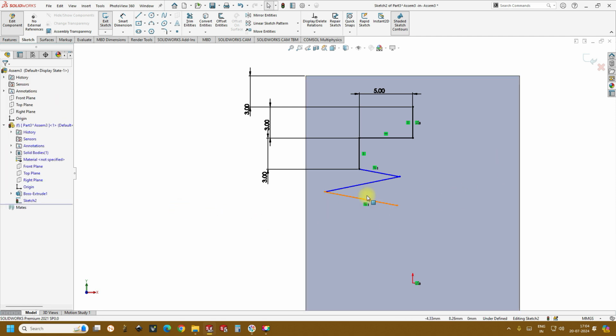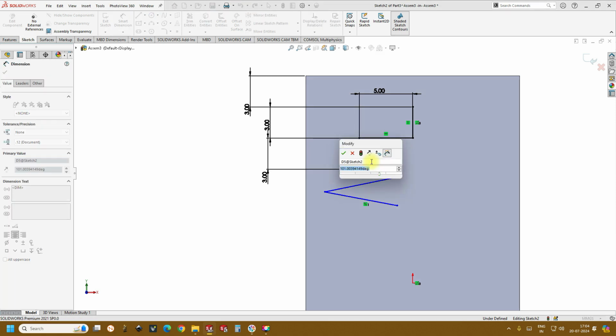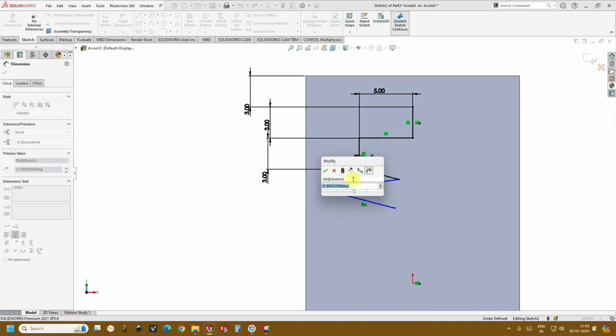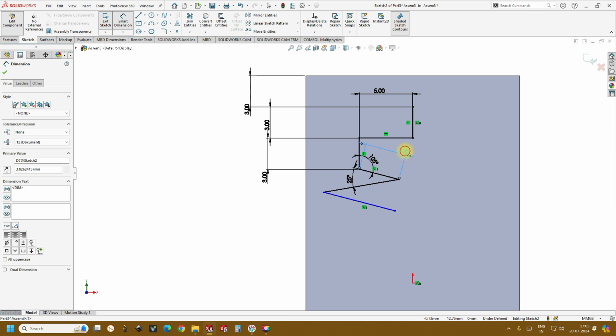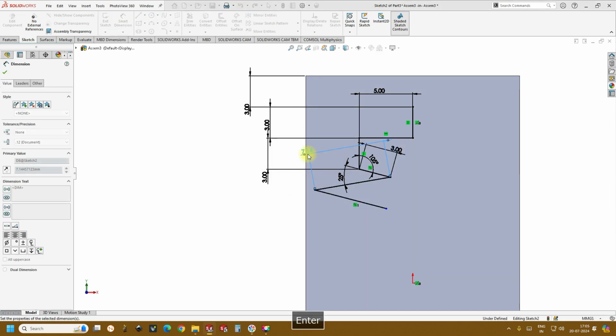Select, and now if you see here, this is the angle that plays a major important role. So depending on the application type or the mixing efficiency requirement, you change this angle. For now I keep this as 105 degrees, and the angle between the two zigzag planes we'll keep as 25 degrees, and it is all dependent on the application as I told previously. I'll keep this channel length as 3 mm, so we'll change this to 3 mm, and followed by this, we'll keep it as double, so then it will be 6 mm.